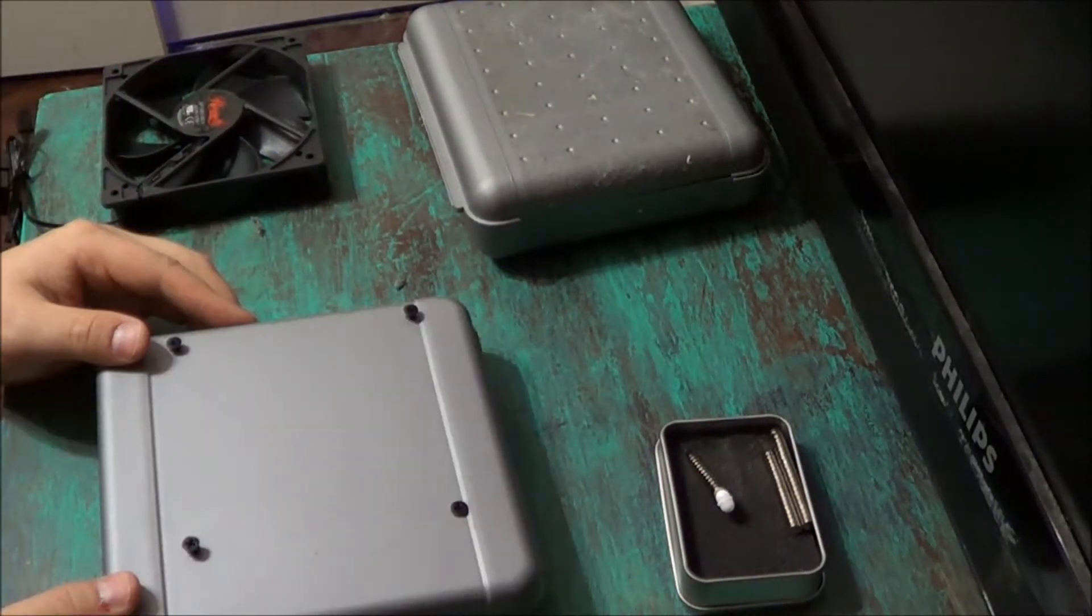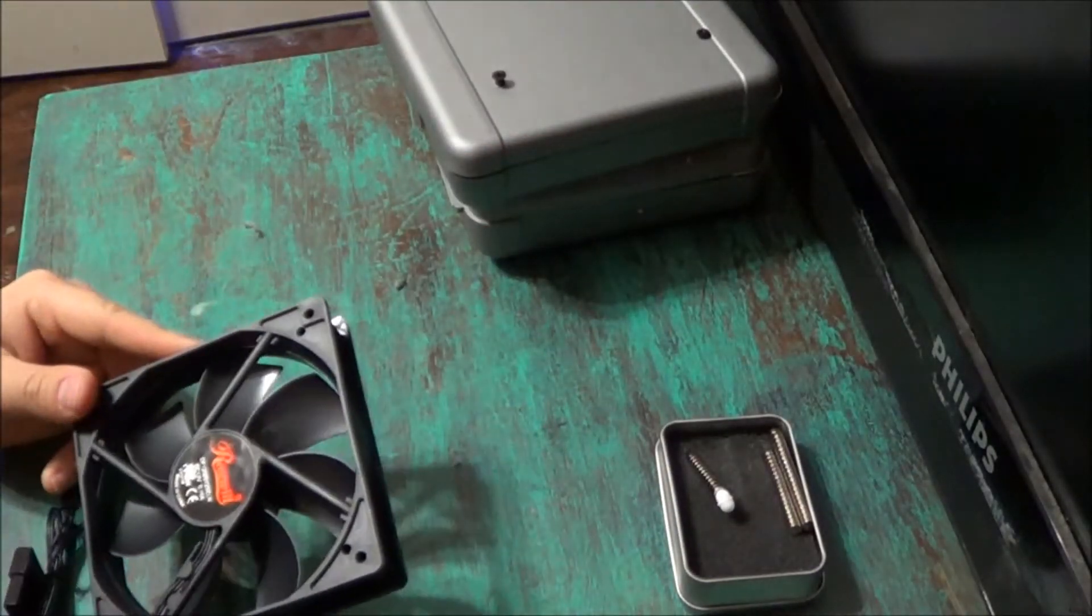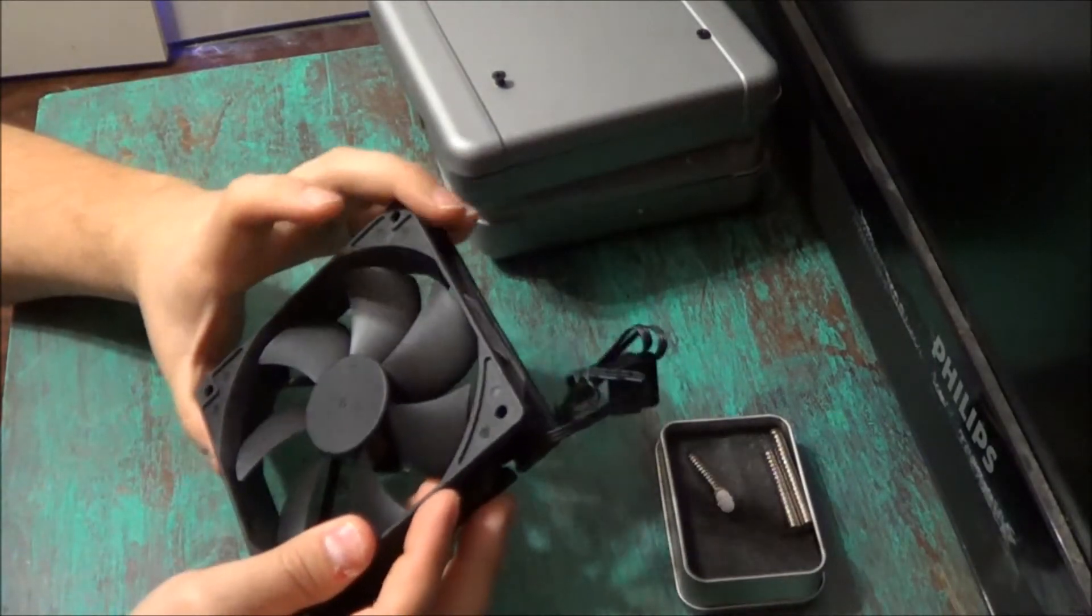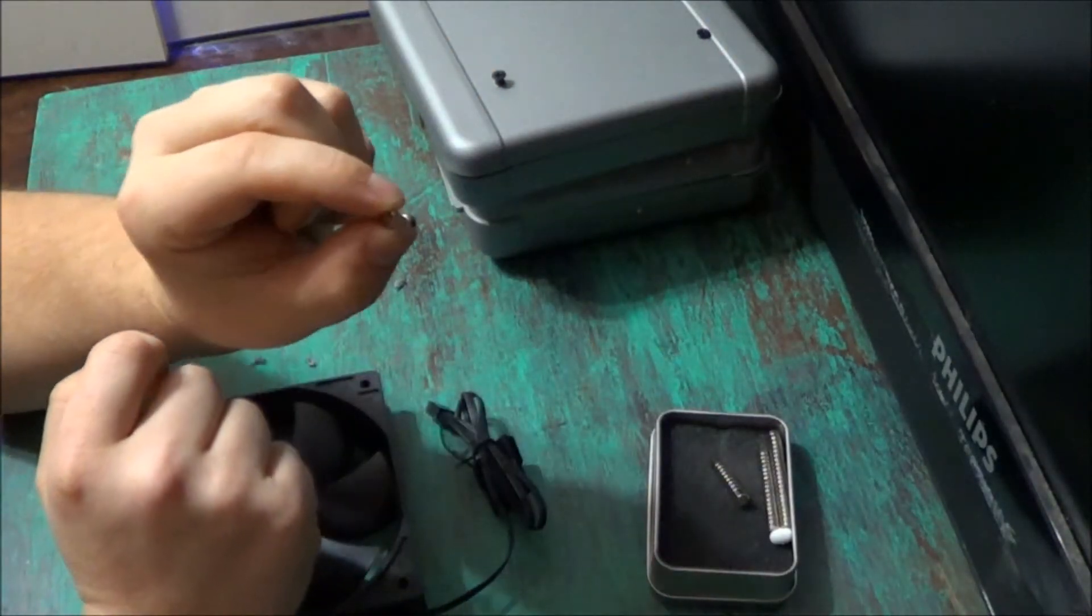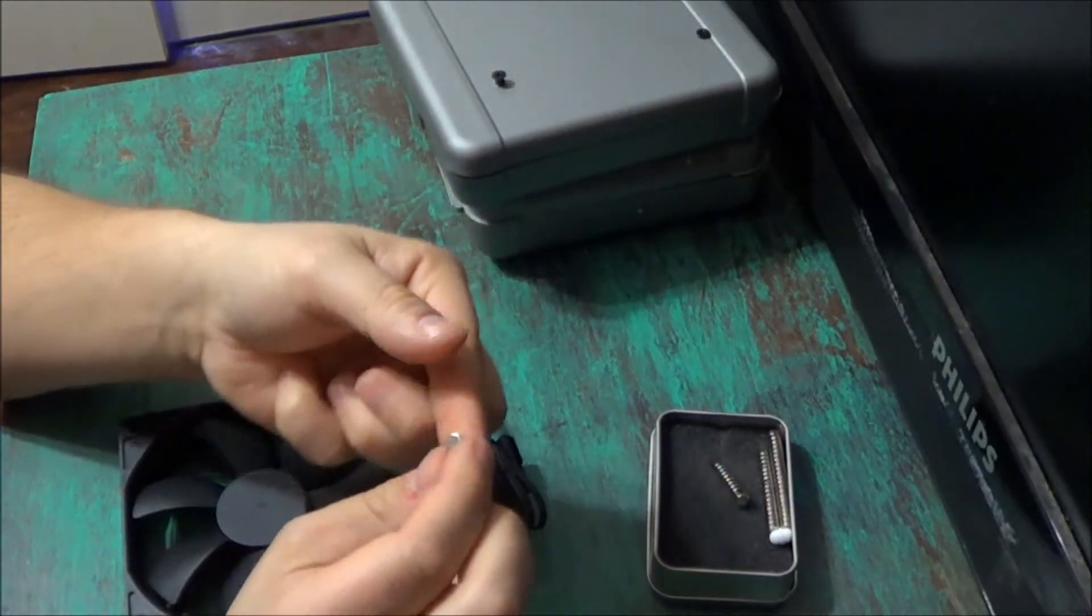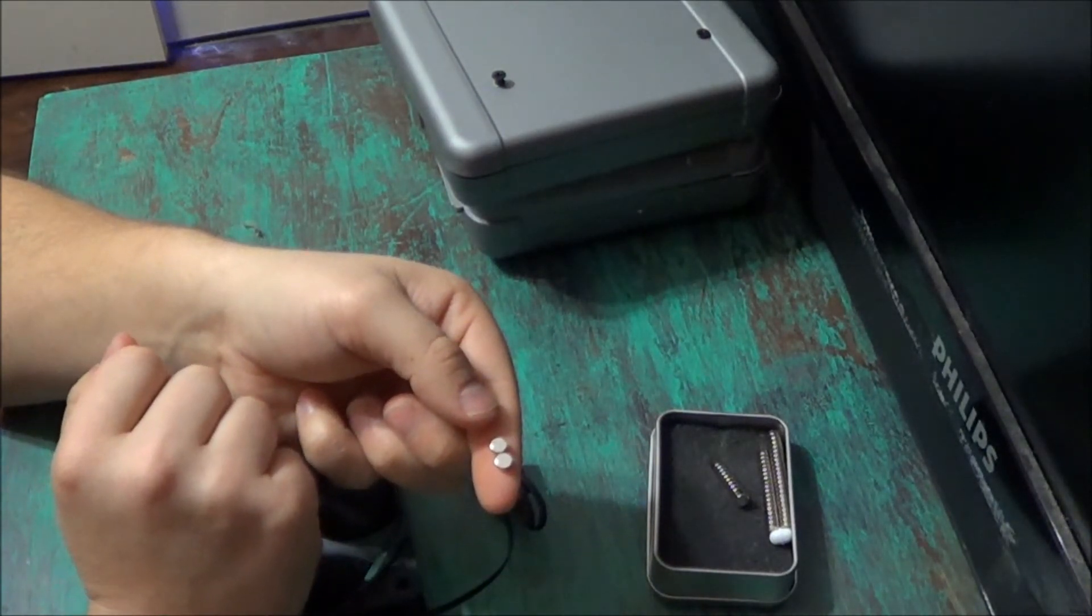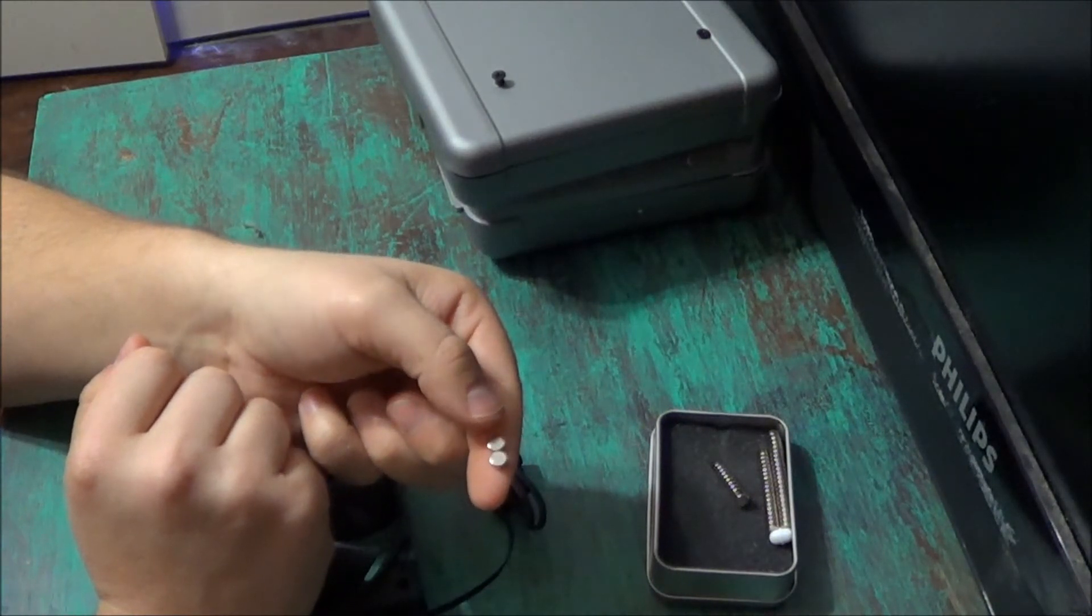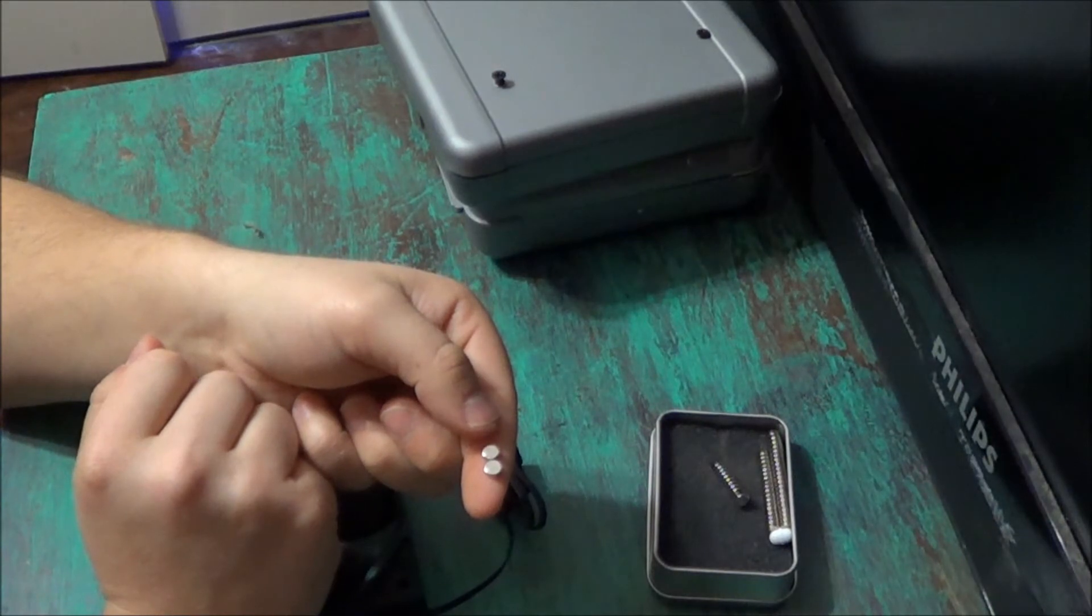Now, next thing I want to do is I want to set my box aside, pick my fan back up, and flip it over to the side that doesn't have the cross bars, which are these. Take my little round magnets, and I am going to turn the poles opposite of each other. That way when I go to put the little stir bar on, it will grab a hold of both ends.